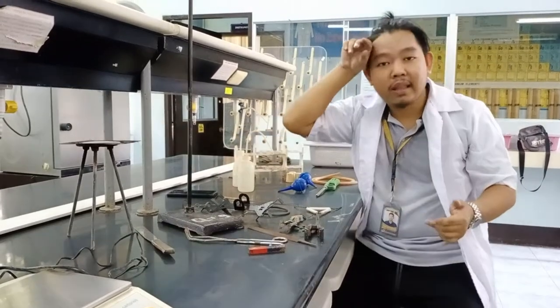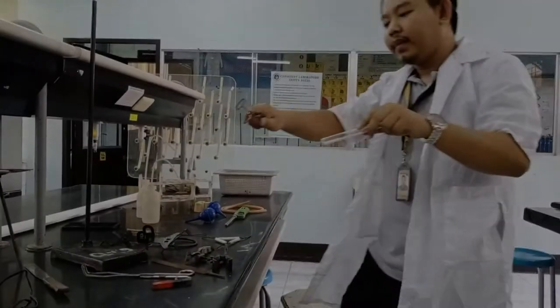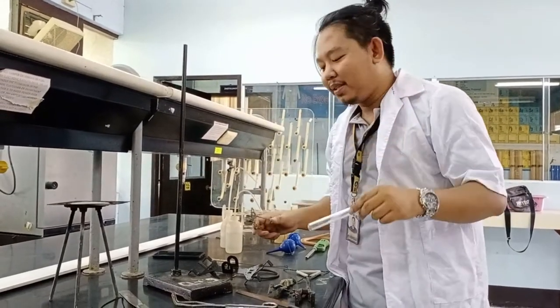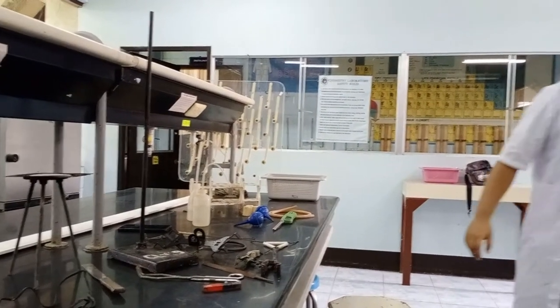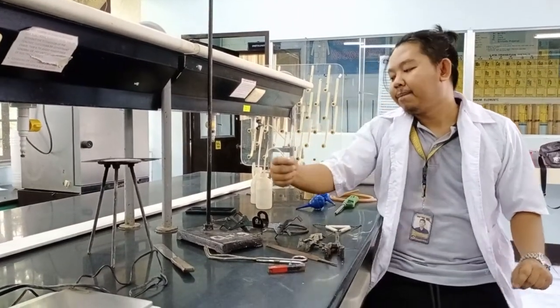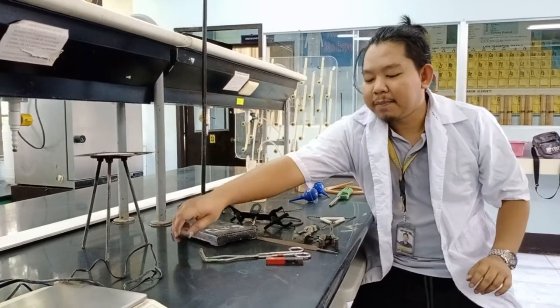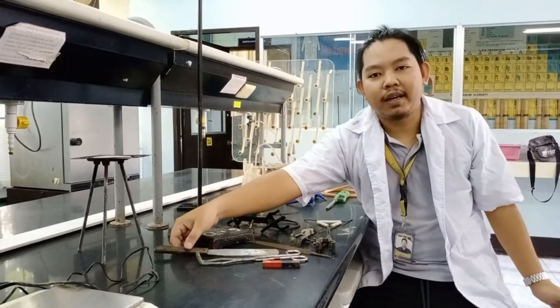This is a test tube holder. We place the test tube in it and release safely — because if you broke it, you'd have to pay for it. And then this is a test tube brush — it's metal and used to clean the inside of our test tubes. We also have our crucible tong, a magnet, and the spatula. That's it for our metals.